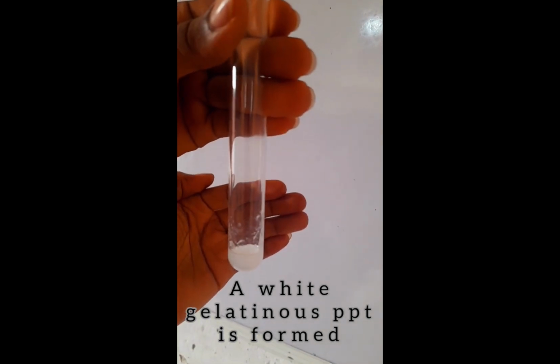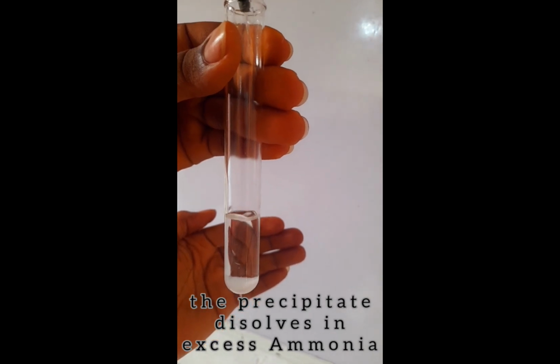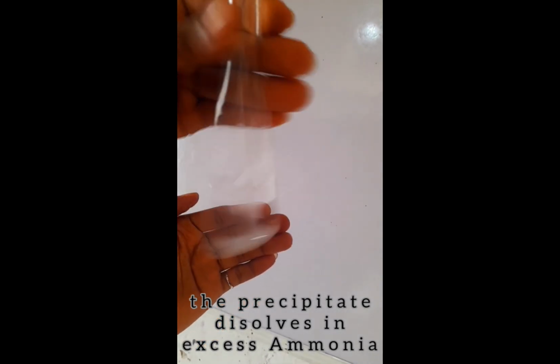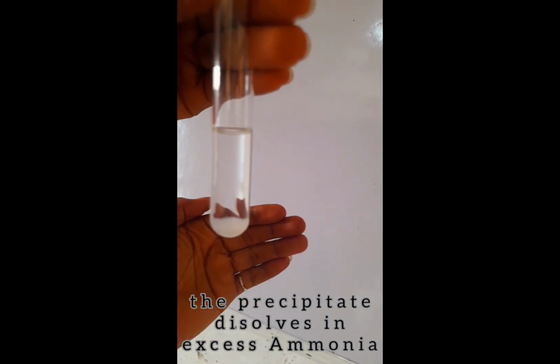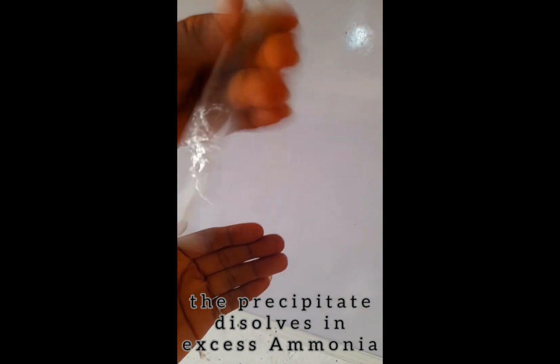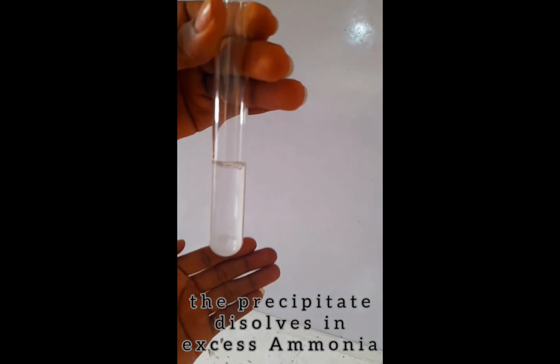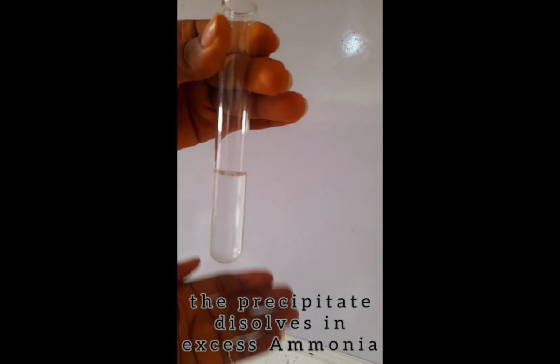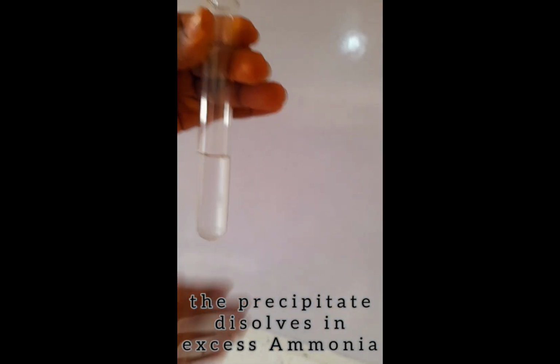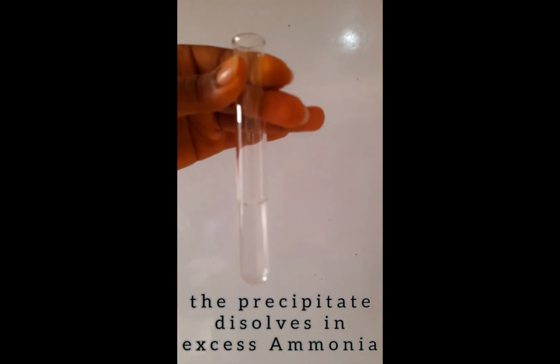So a white gelatinous precipitate is formed, but the difference between ammonia and sodium hydroxide is that if you add excess ammonia to the white precipitate solution, the white precipitate will dissolve. So zinc ions dissolve in excess ammonia.